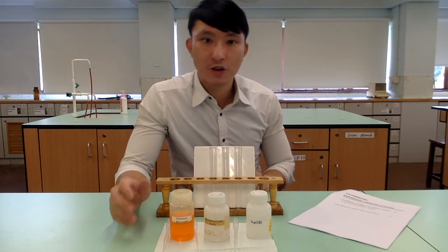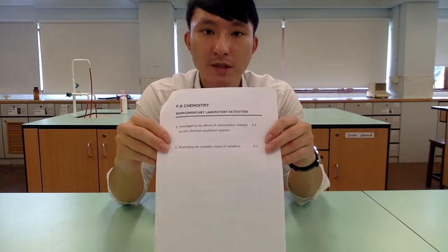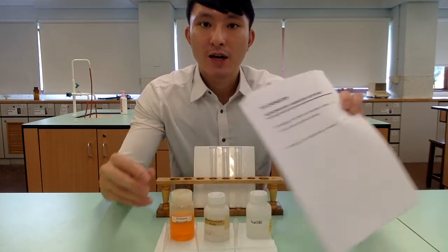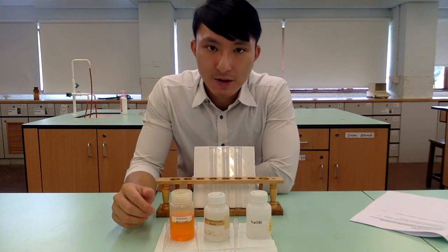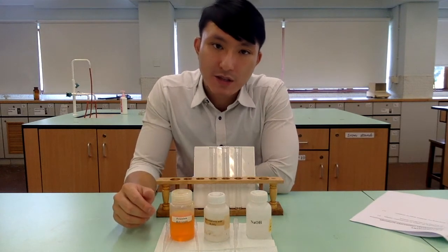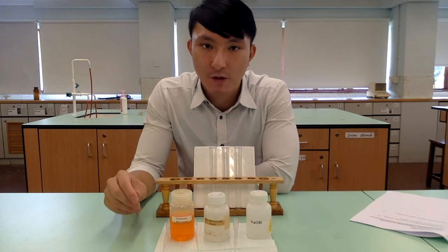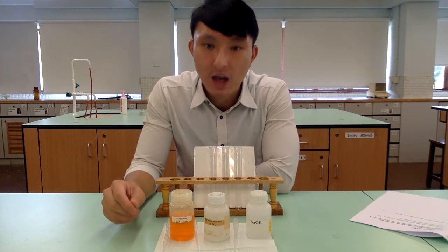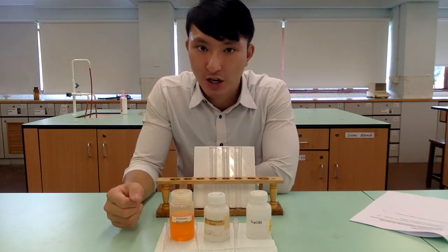In this video, I'm going to show you the first experiment from our Form 6 Supplementary Laboratory Activity Booklet. Basically, we are looking at two classic chemical equilibrium systems, and we want to see how the change in concentration of some of the chemical species involved will affect the color of the reaction mixture.